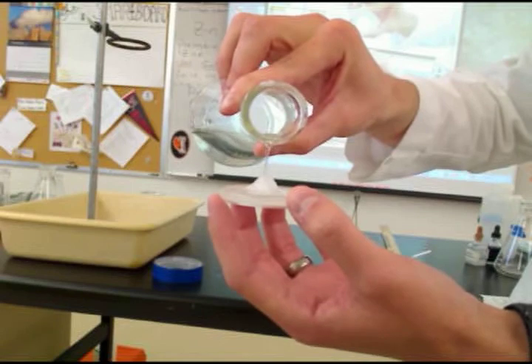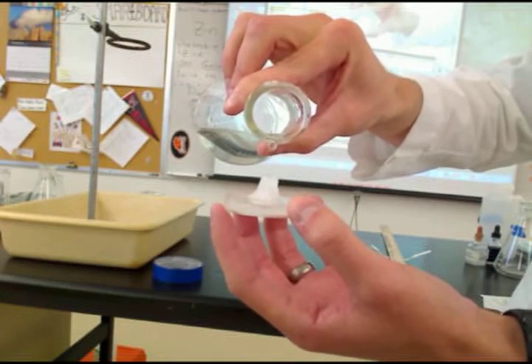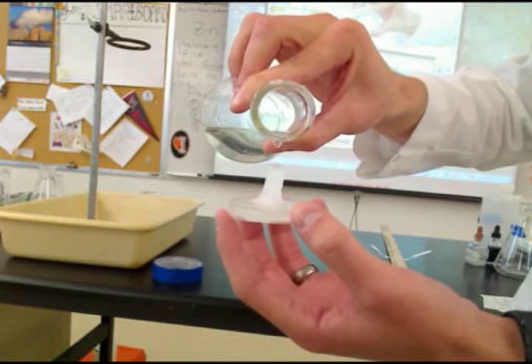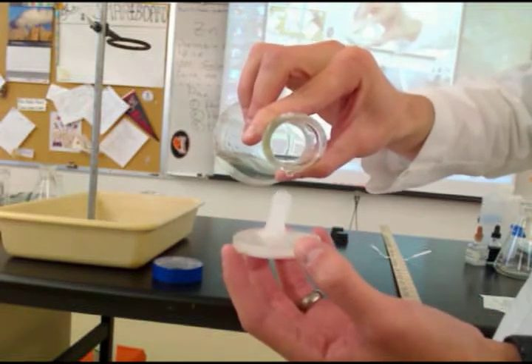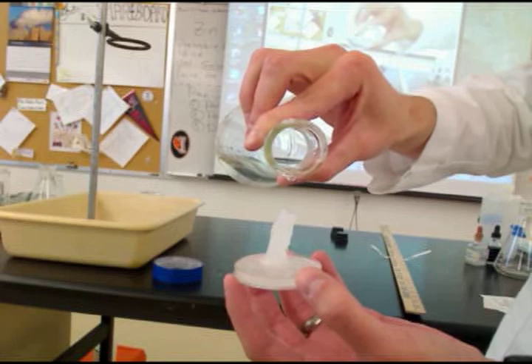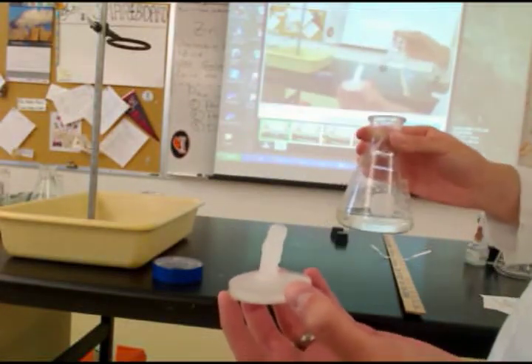So if I keep doing this, I can make a little mountain. Can you lower it just a little bit? It's a top secret.